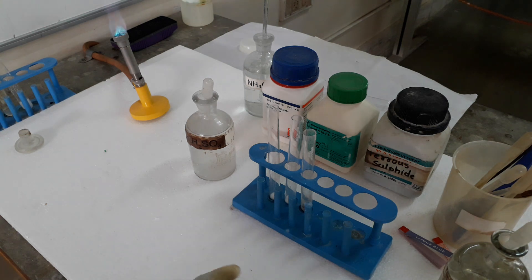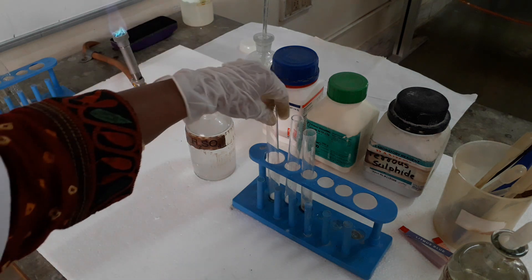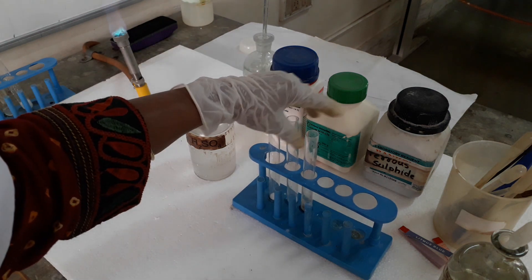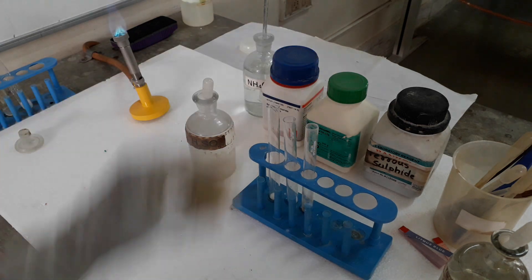Hello students, we will do detection of anions. In the first video we detected carbonate, sulfite, and sulfate, and now we will see the other three anions: chloride, nitrate, and sulfide.